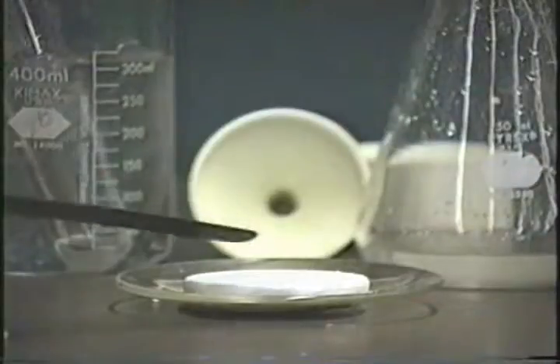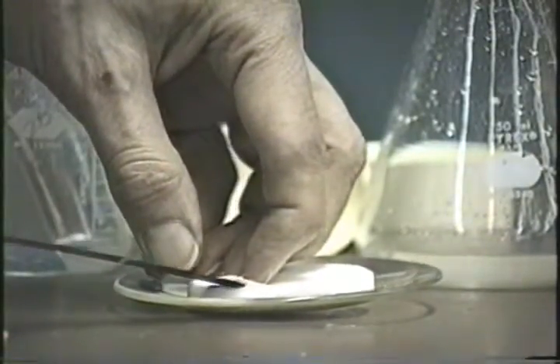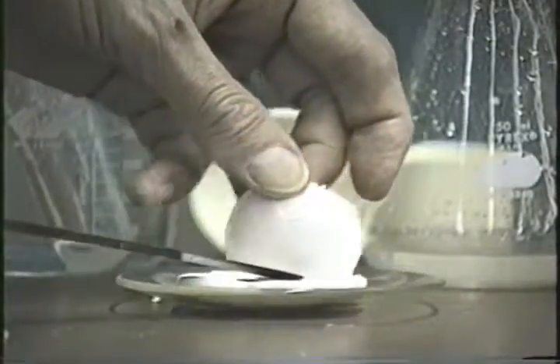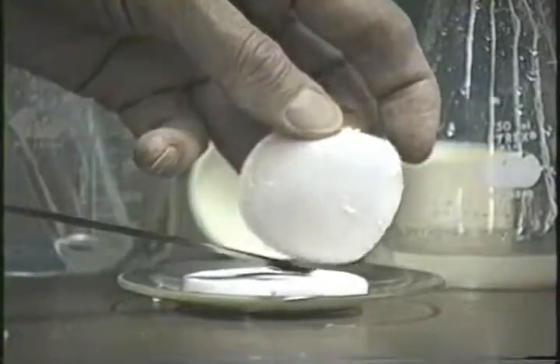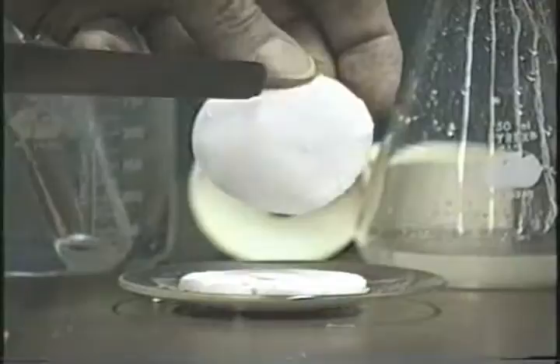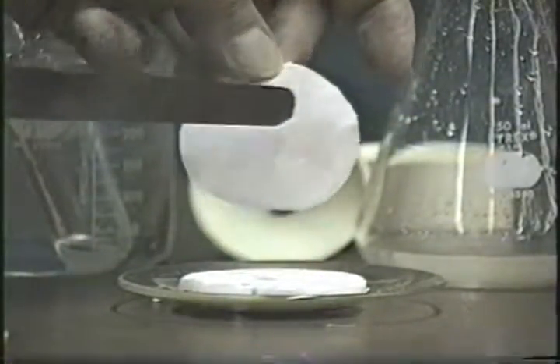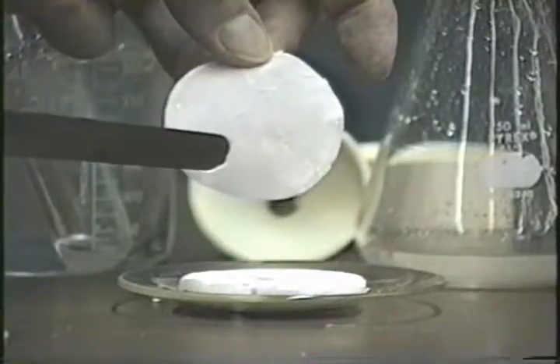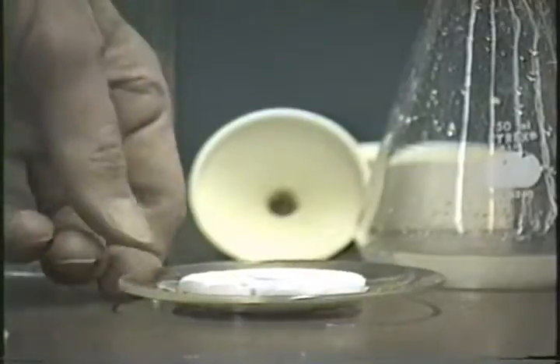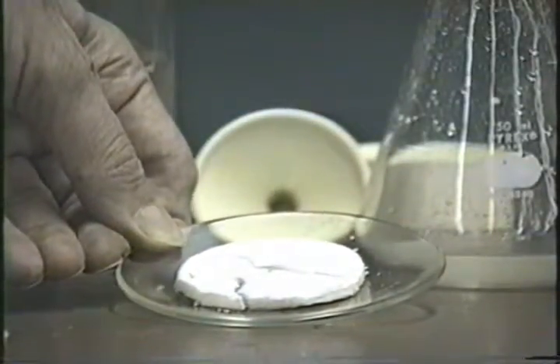But anyhow, once you have it on the watch glass here, make sure that you remove the filter paper. It looks like there isn't any filter paper here, but there actually is that one sheet of filter paper, so make sure you get that off. Or if you have 2 sheets, make sure you get both sheets off. If there are any little flakes of sodium bicarbonate hanging on the filter paper, you can try and knock them off, but don't dig into the filter paper to get lint into your product. Well, there's your product, and it's all set to dry till next week.